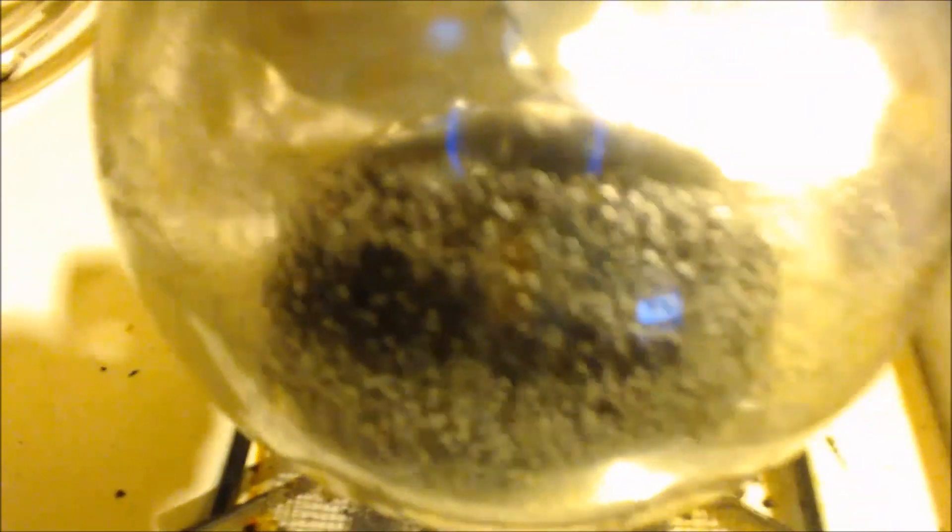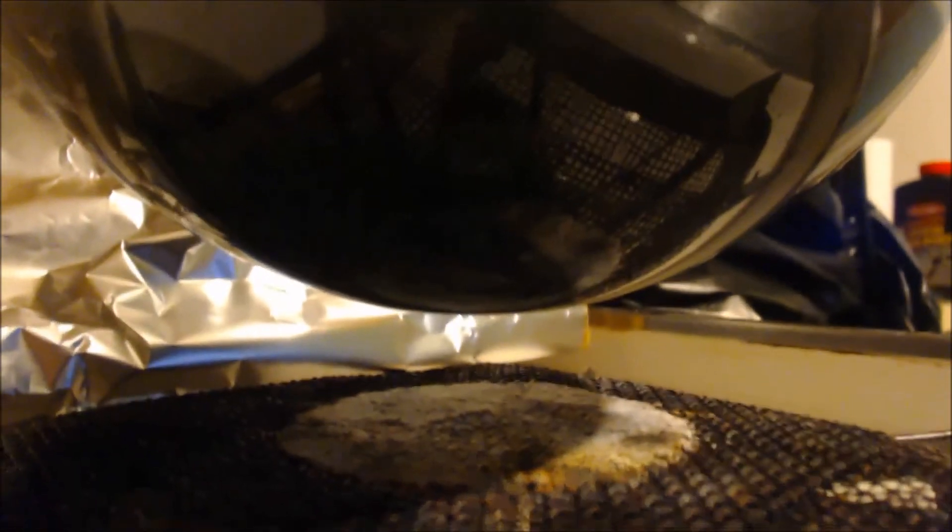All right. Check this out. The liquid is still gray. It's not any kind of green or anything. I don't get this at all. But I want to just reflux it to get this. Because I still got stuff down here. I don't know if you can see the metal. See how there's two different colors there. That metal is like a film on the bottom of that.